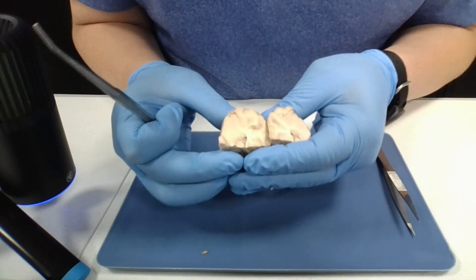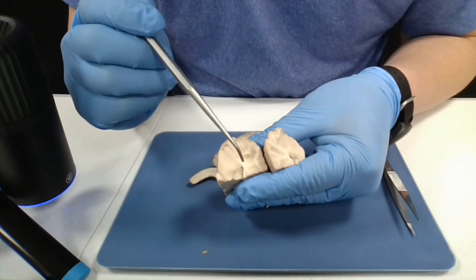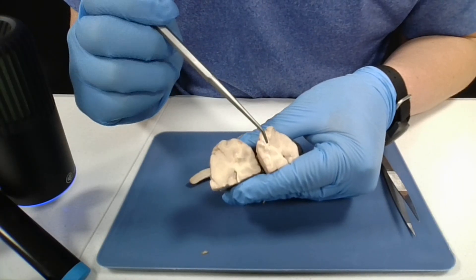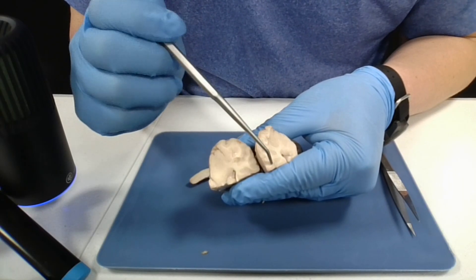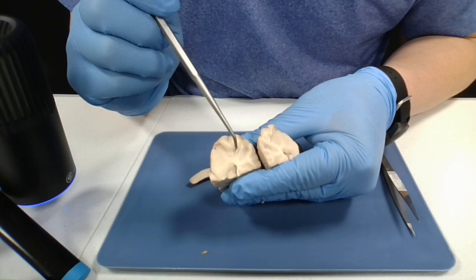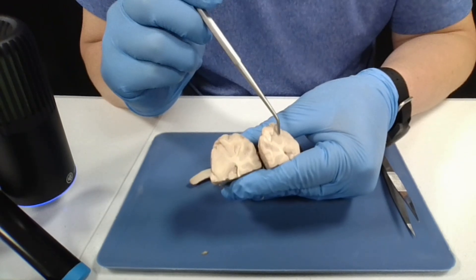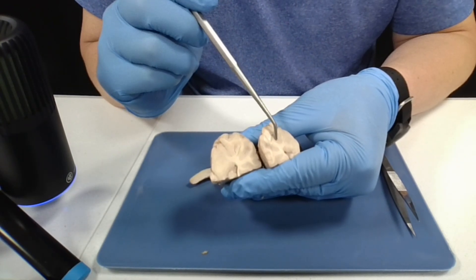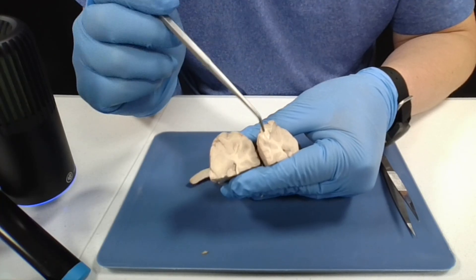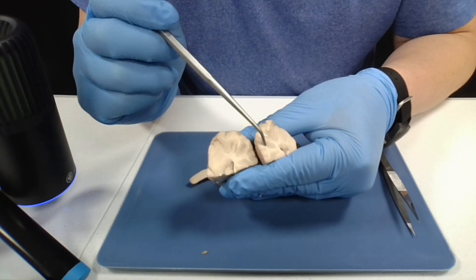You can see the gray and white matter on the inside of the brain. The gray matter is on the outside and the white matter is on the inside, which is actually opposite of the arrangement in the spinal cord. The gray matter is mainly unmyelinated axons, cell bodies, and dendrites, while the white matter is myelinated — and that's what gives it its white color.